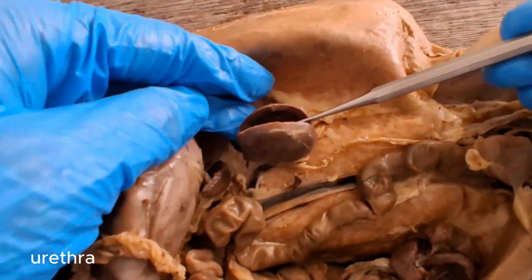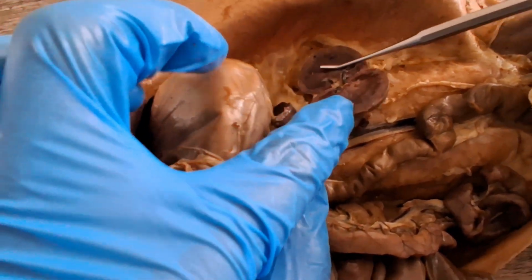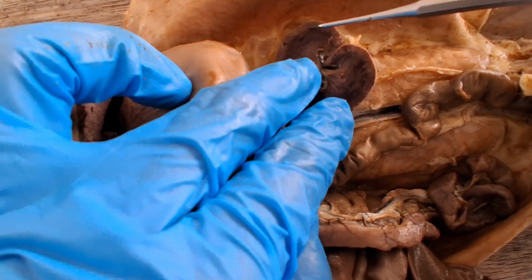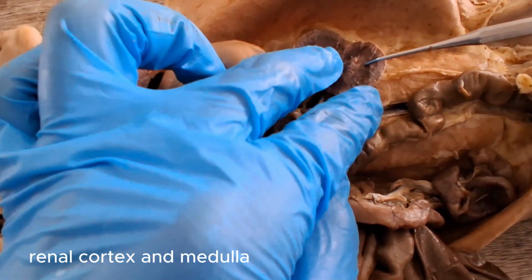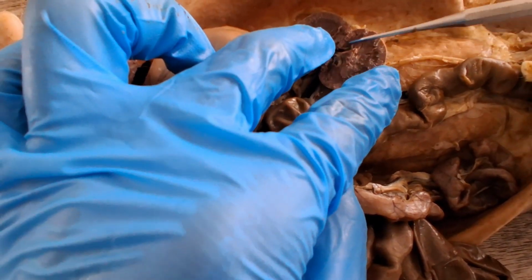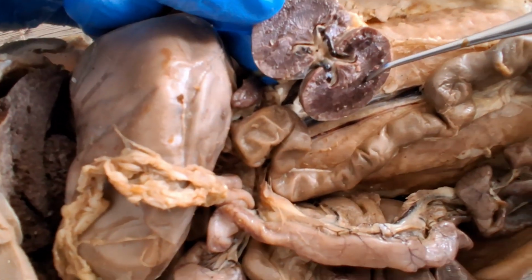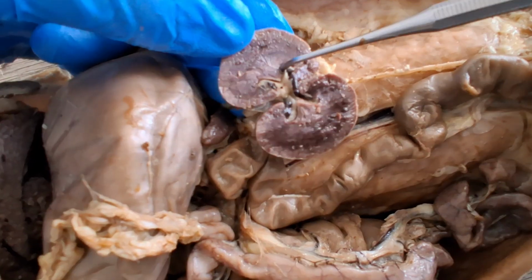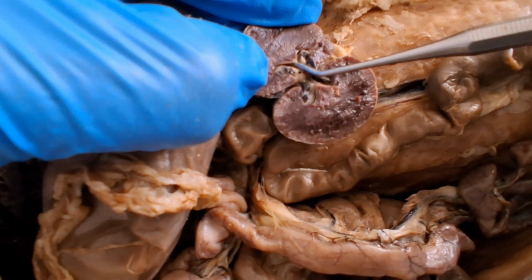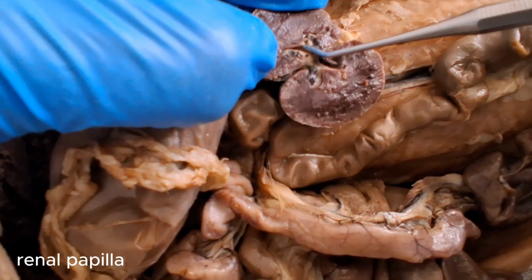If you make a frontal section of the kidney, you'll see some of the parts. That outer layer is the cortex, the inner darker layer is the medulla. That pointy end is the renal papilla.